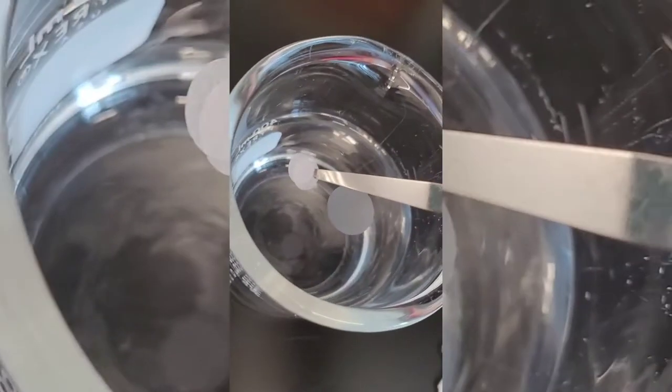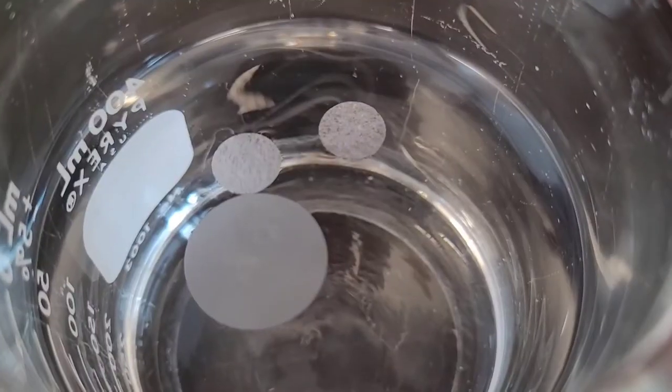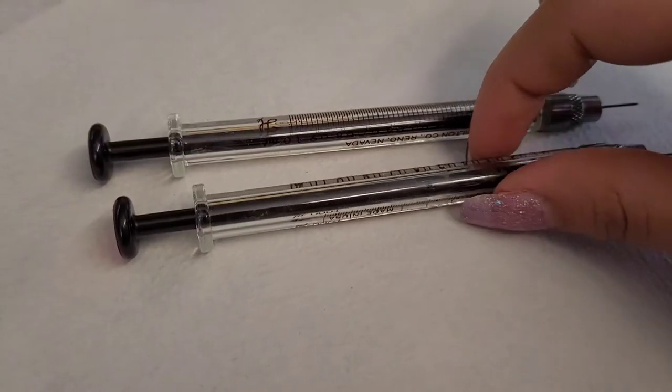One big filter, which is the actual filter, and two small ones, which are the supports for the filter. Hydrate them in your buffer.